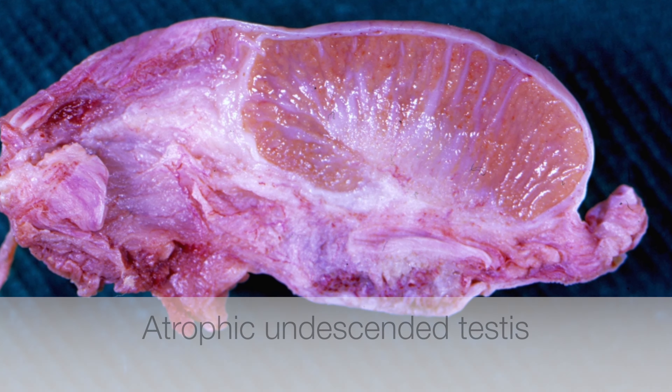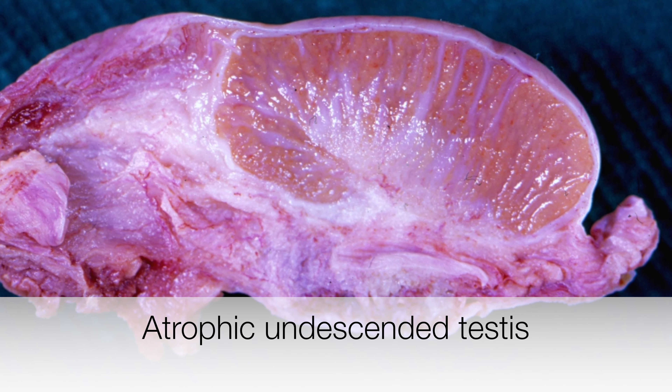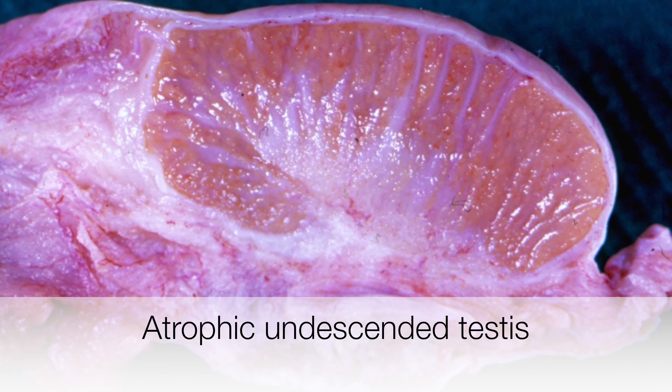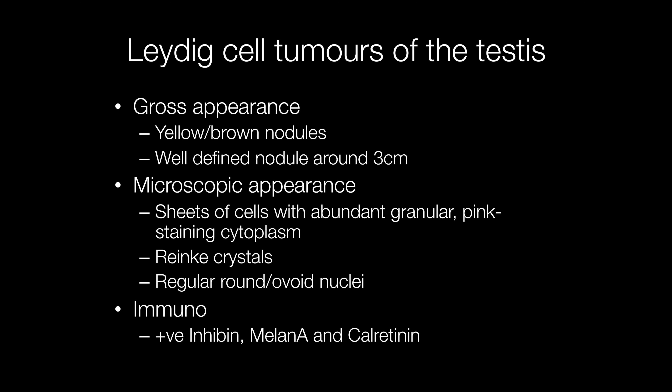Here is an atrophic undescended testis, although technically it has descended into a pathological specimen. The typical gross appearance of a Leydig cell tumour is a well-defined nodule around three centimetres across with a yellow or brown cut surface. In children, the Leydig cell tumour will be smaller, around one centimetre across.